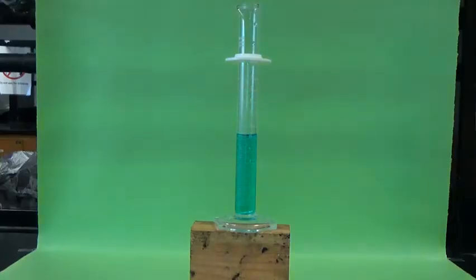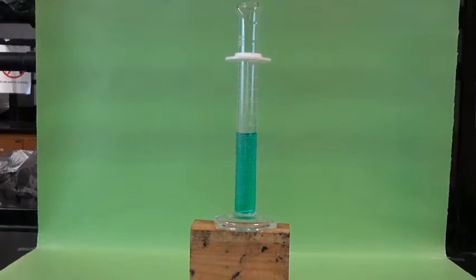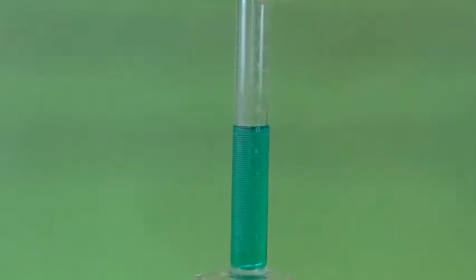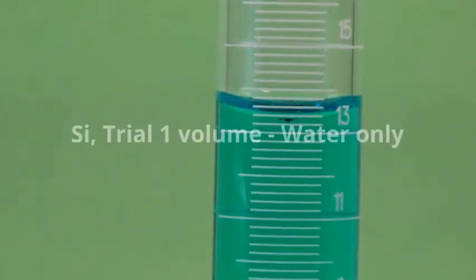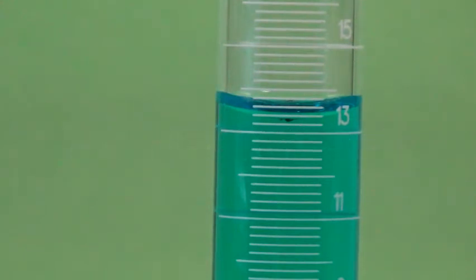So there's our graduated cylinder with some water. I just put the water in there. It's got some blue food coloring in it, so you can see a little bit more clearly. I'm going to zoom in here on the meniscus. So based upon that, it looks like the bottom of the meniscus is on the second line. So I'm going to call that 13.4 is the volume, 13.40.